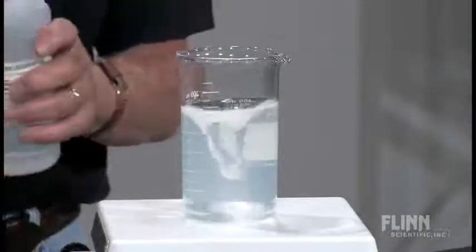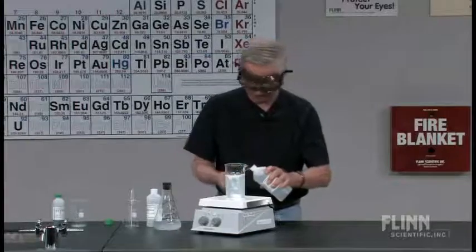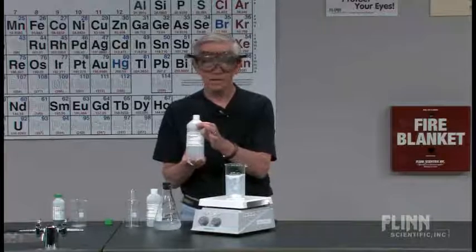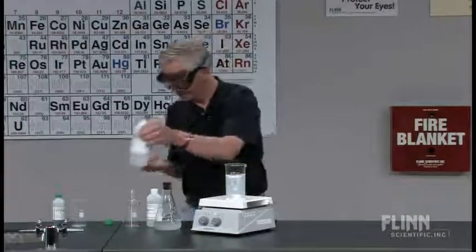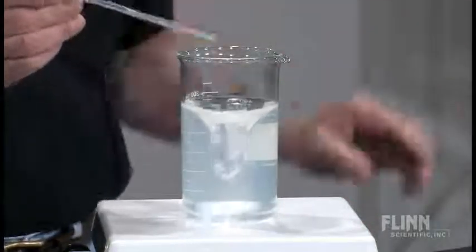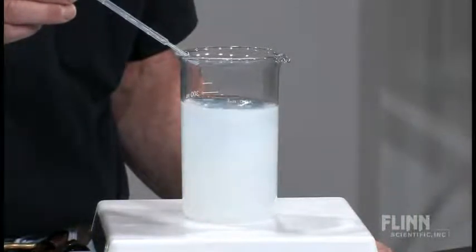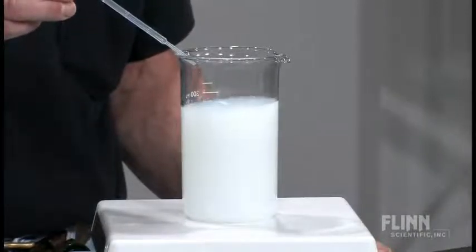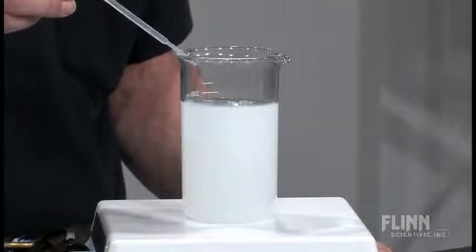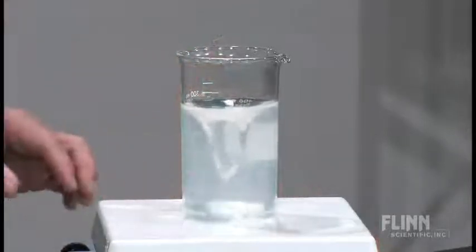Let's go back the other way. In this case I have 3 molar sodium hydroxide. So now we're starting at the left and going back that way. As I add, I get towards the isoelectric point — it's starting to get pretty murky. Don't want to leave it there, keep going, and now I'm back to where I started.